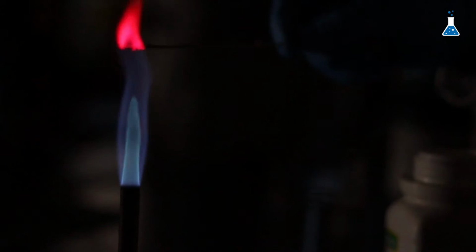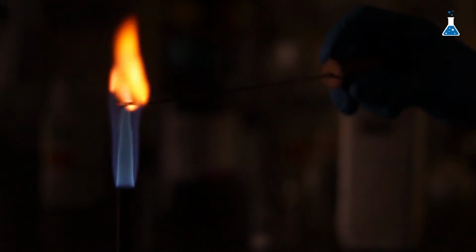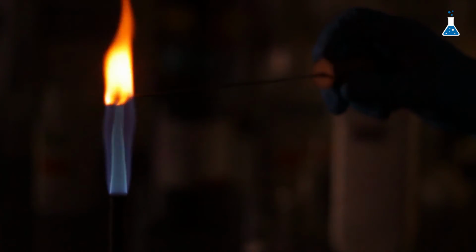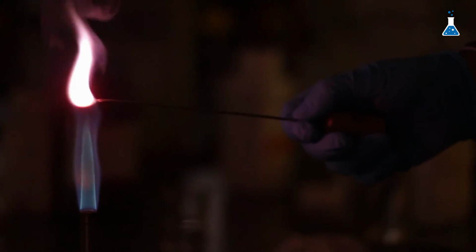It consists of taking a little sample of these salts and placing it over the flame. We can see in the case of the lithium ion its characteristic beautiful crimson color. Now I'm going to rinse the wire in order to remove any residue of the lithium salt that can be on it. And we can keep on doing the demonstration with sodium. Now we can see the typical bright yellow color, which is characteristic of sodium. After rinsing again, I'm going to finish with potassium, and we can observe its characteristic lilac color.